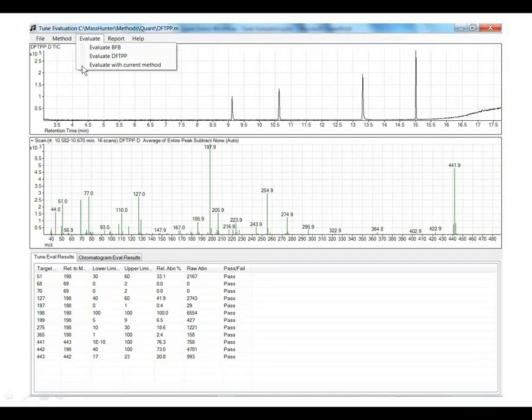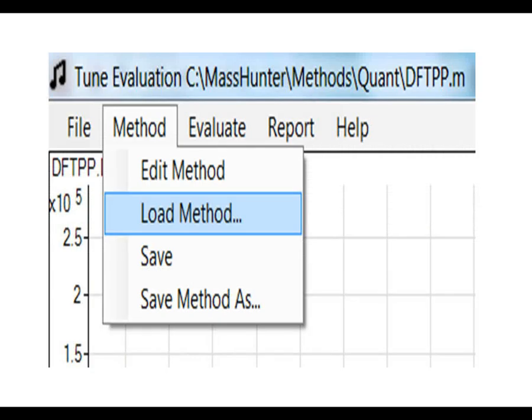One is to evaluate a tune compound, and that could be BFB or DFTPP or even your own, and it provides chromatography evaluation capabilities such as evaluating tailing. Let's step into how this works in Tune Evaluation.